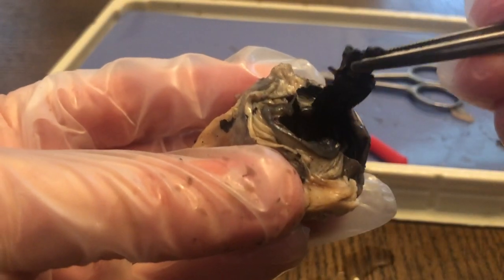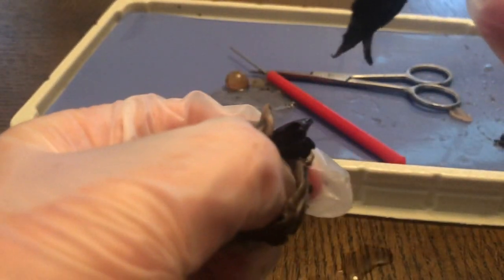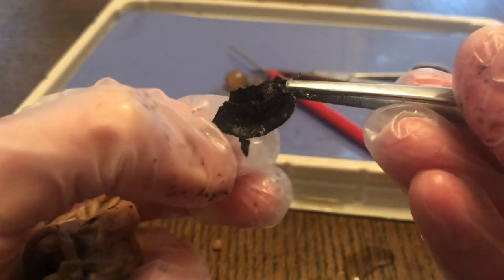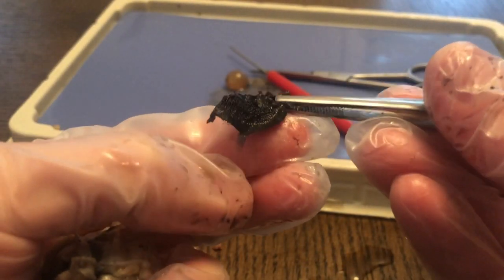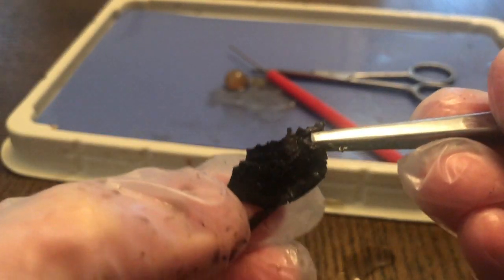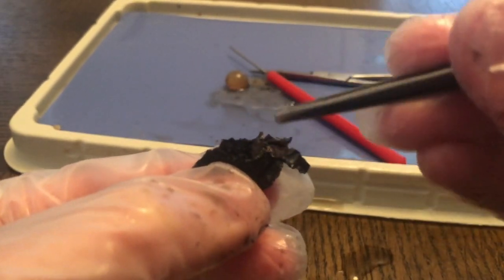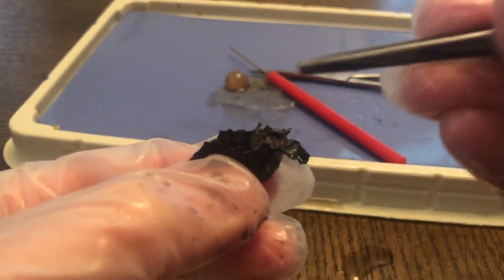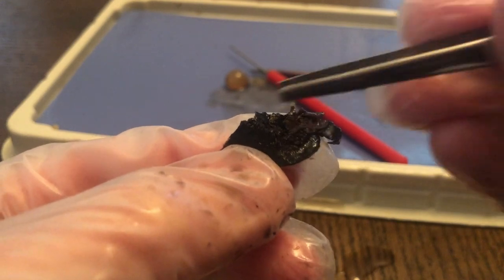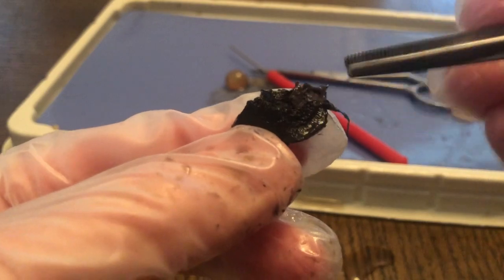Now I'm going to remove this part of the eye, and this is actually the iris. And I don't know if you can see, but this is a muscle that will contract. There's many different little lines on it. Now this muscle actually makes the color of the eye. Okay, so it can be blue. And I broke off a piece, so I only have a piece of the circle. I have about a third of it. And so that's the iris.